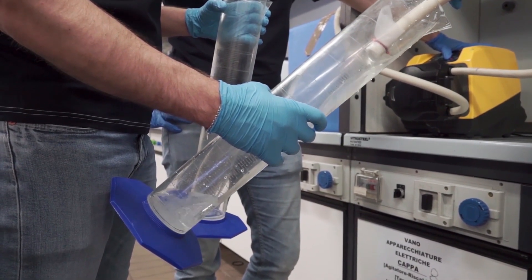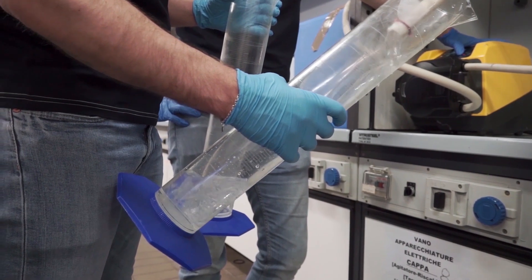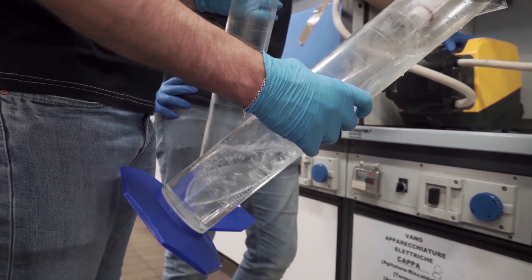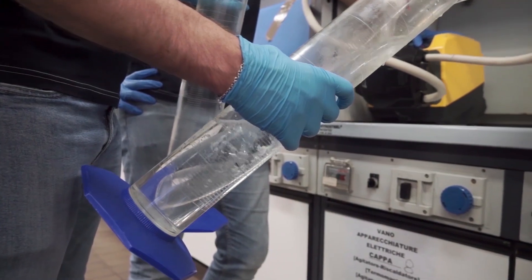First of all, fill the tube completely with the chosen solution, eliminating the presence of air.